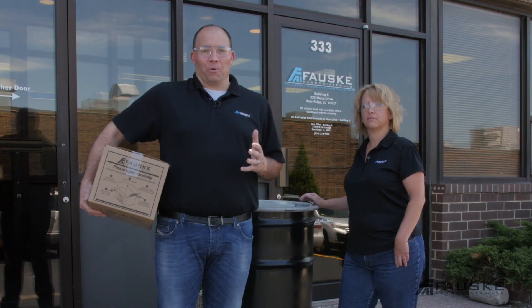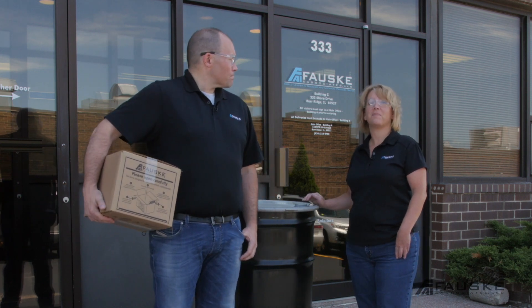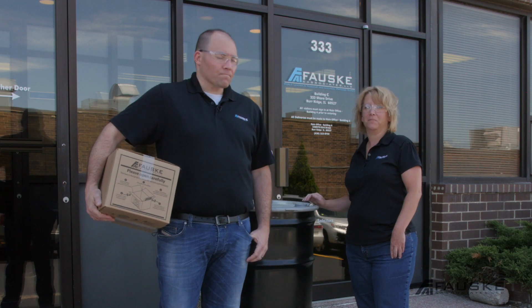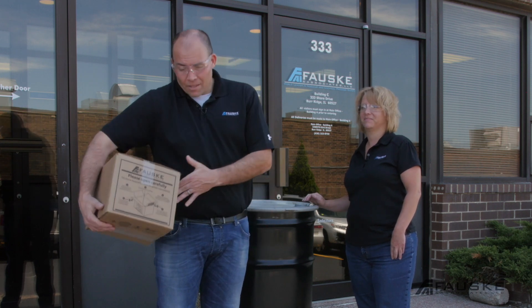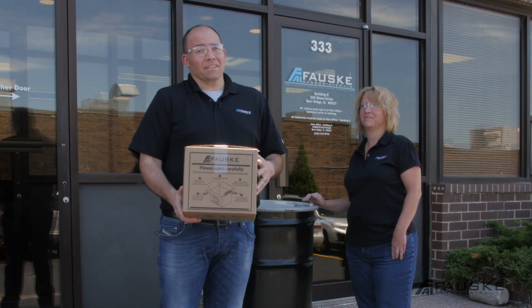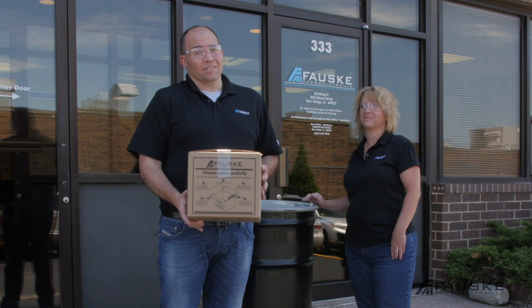Keep in mind the amount of sample needed to do testing inside the cubic meter chamber. Many of the tests require a minimum of 20 to 30 pounds of sample. This is one area where our dust kit just won't cut it for this test.